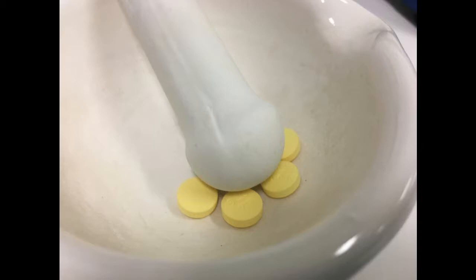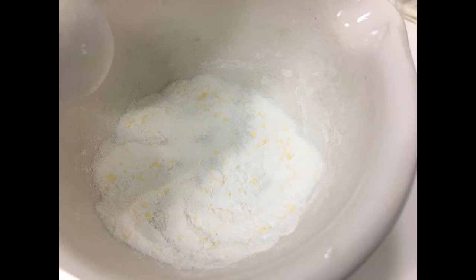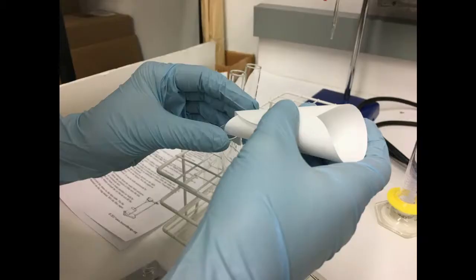First, we crushed up four caffeine tablets. In this example, we used a mortar and pestle, but you can also put the tablets in between two pieces of paper and gently crush them using a jar or another tool.